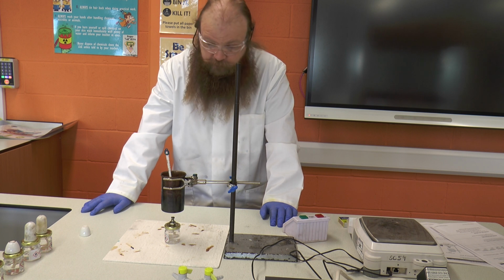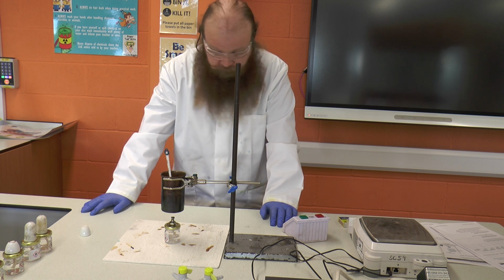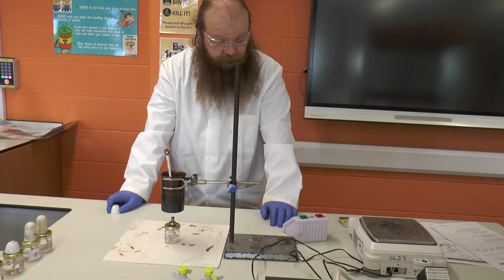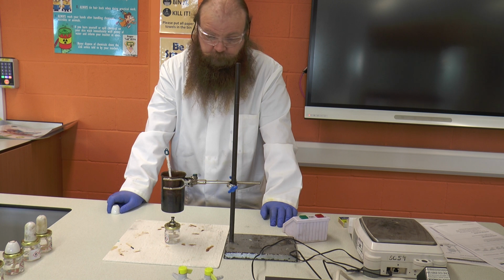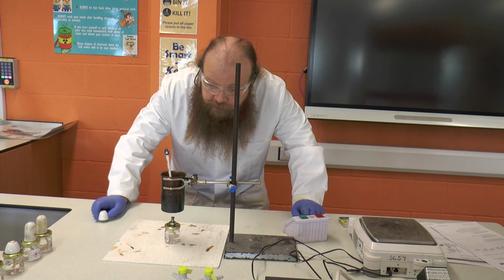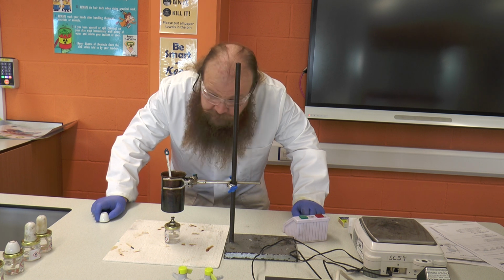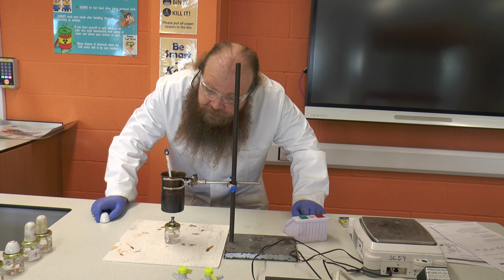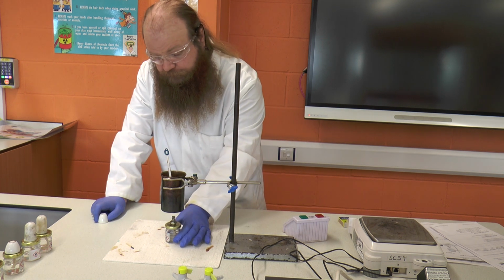We're nearly at the 2 minute mark. Right, so we're approaching the 2 minute mark, so we're going to make sure that we're ready to take our reading at exactly the 2 minutes. So we're at 2 minutes and we are at 67 degrees.